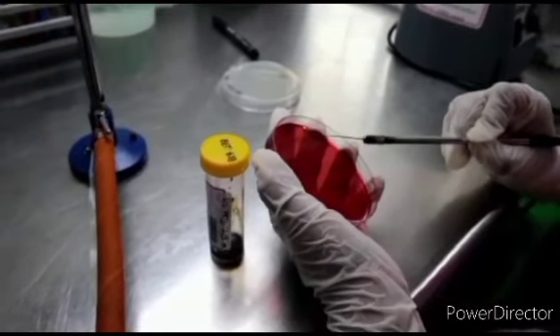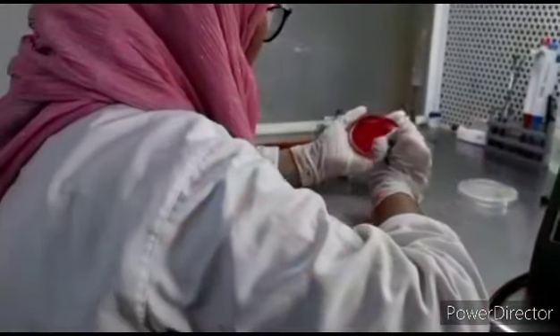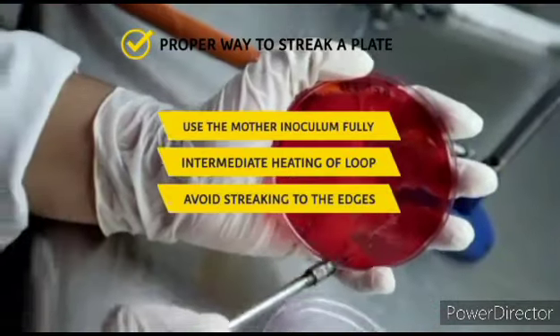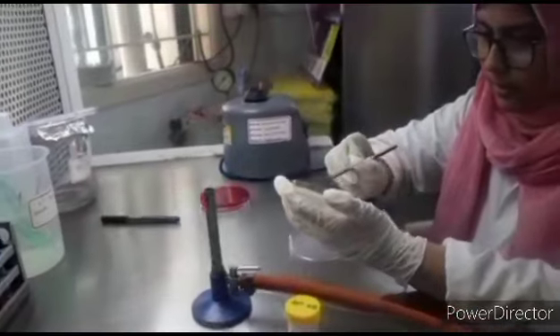After that, the plate is slightly rotated for each secondary and tertiary streaking, and the streaking should be done in a zigzag way. Between each streaking, intermediate heating of the loop is essential to get isolated colonies. And also, the streaking should not touch the edges, to avoid cross-contamination.